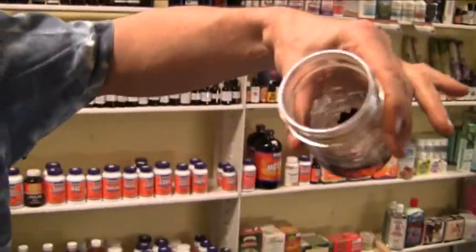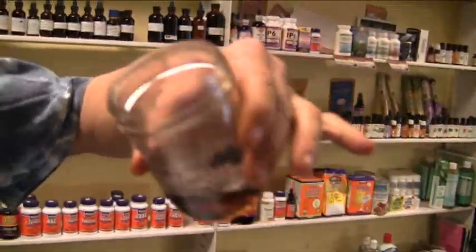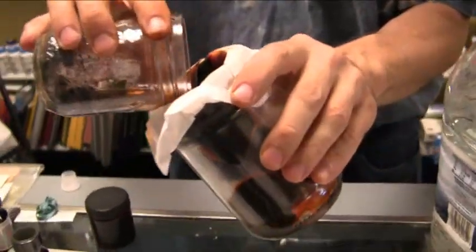Look at this — this actually came out better than the first time! Now, to make a Lugol's solution, it's a two-to-one solution. So whether you're using 88 grams and 44 grams like the Hulda Clark formula, or 10 grams and 5 grams, or 100 grams and 50 grams — whatever — to one liter of water or 1,000 milliliters, that's what you'll pour it into. I am impressed, this actually came out better. Then we filter it, pour it through.